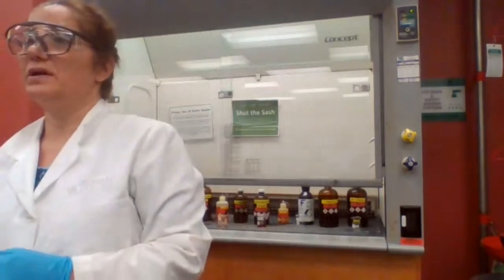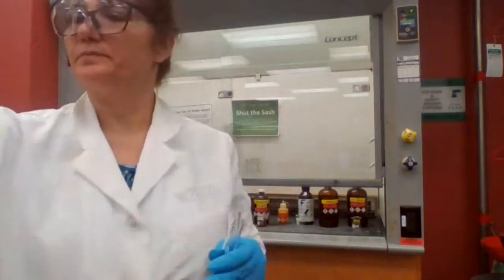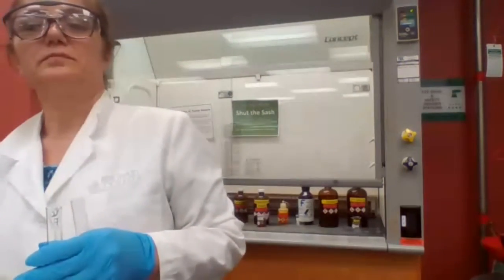I don't see any response. Can you hear me? Would phenol dissolve in water? It's not supposed to, right? It's an aromatic compound.